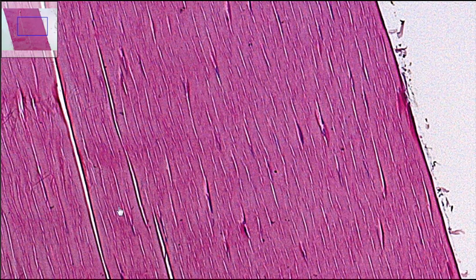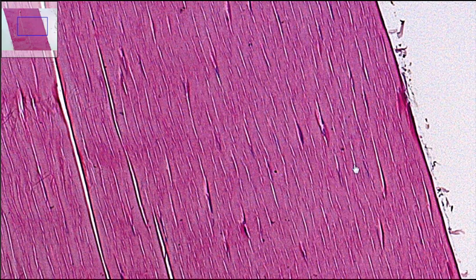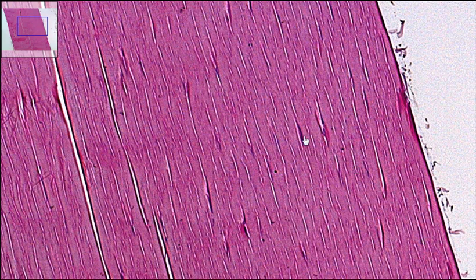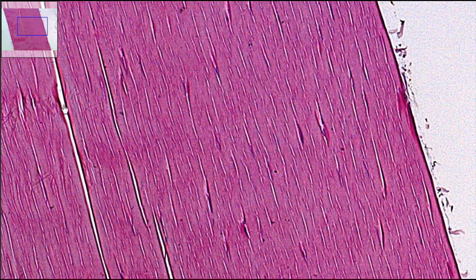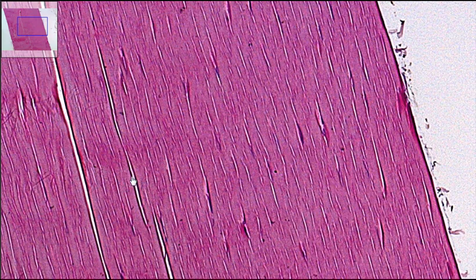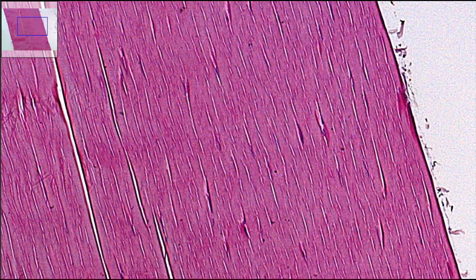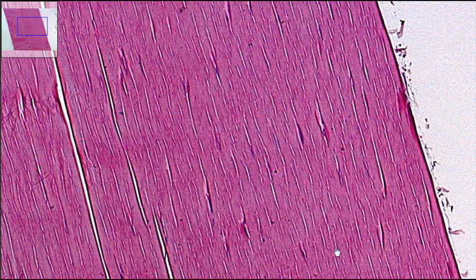The white space represents a little bit of space in between, but there really is not much matrix here. It does have all three components of connective tissue: cells, which are right here; fibers, running up and down; and matrix, the stuff in between. So the key thing for differentiating dense regular connective tissue is the parallel fibers — look for parallel fibers.